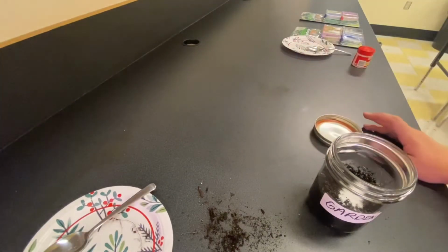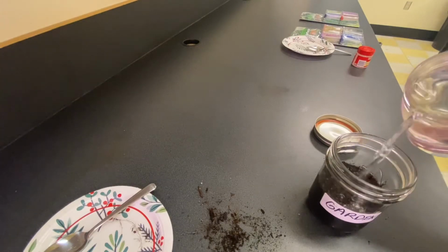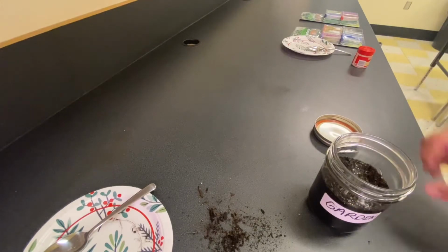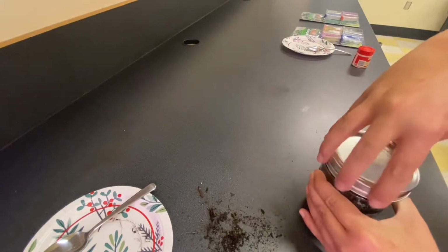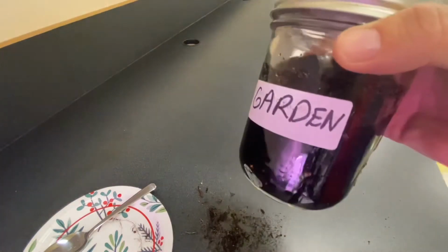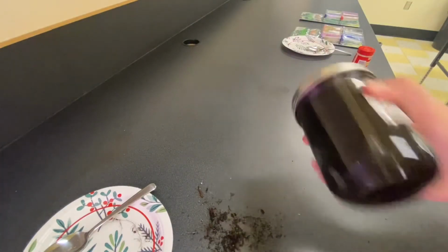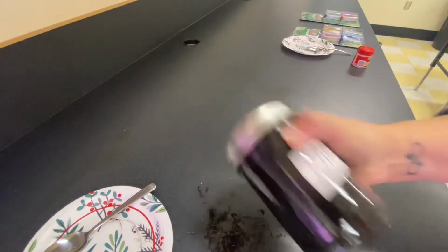After that, I'm going to add more water into our mason jar so that in total, with everything in the jar, we're about 3/4 of the way full. We need a little bit of room for some movement as we shake it. I'm going to place the lid on the mason jar. I'm going to make sure I've sealed it tightly, and then I'm going to shake the jar vigorously. You're going to see a lot of shaking for at least 1 minute to really make sure we've suspended everything in the water.